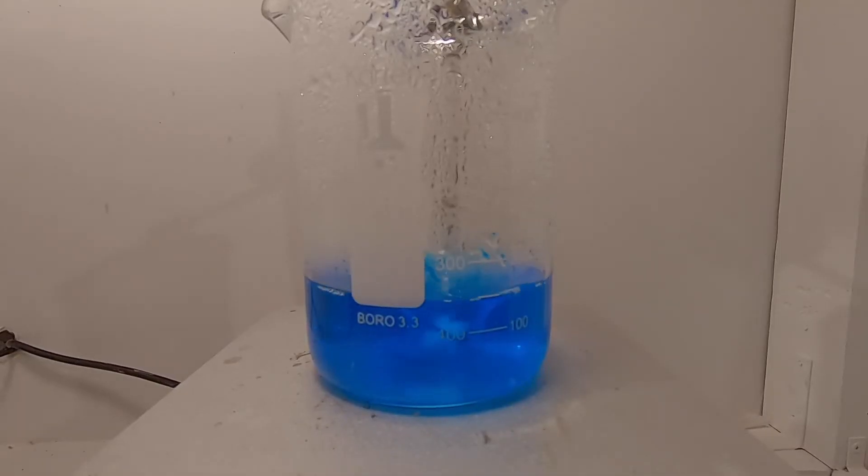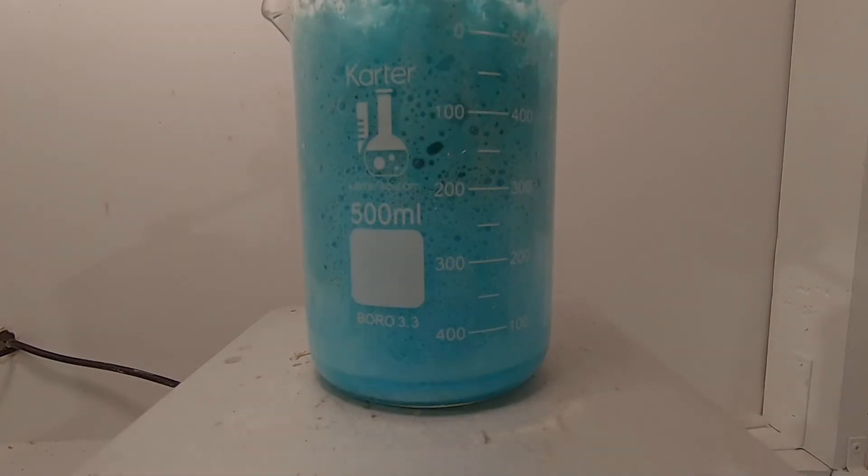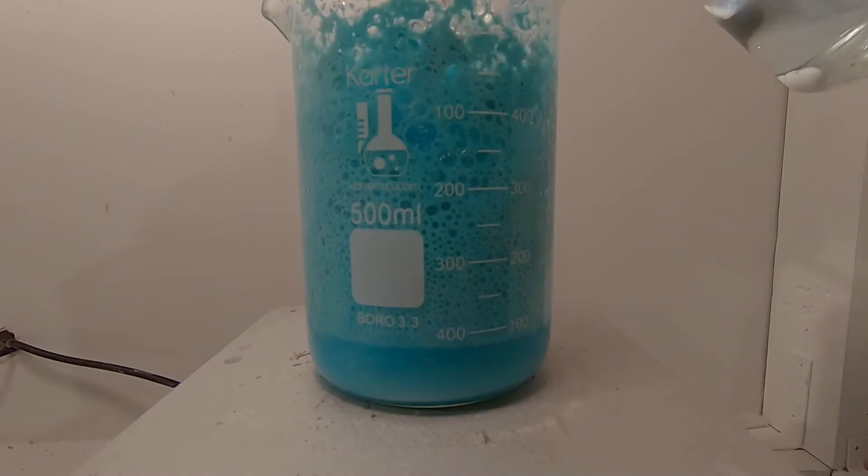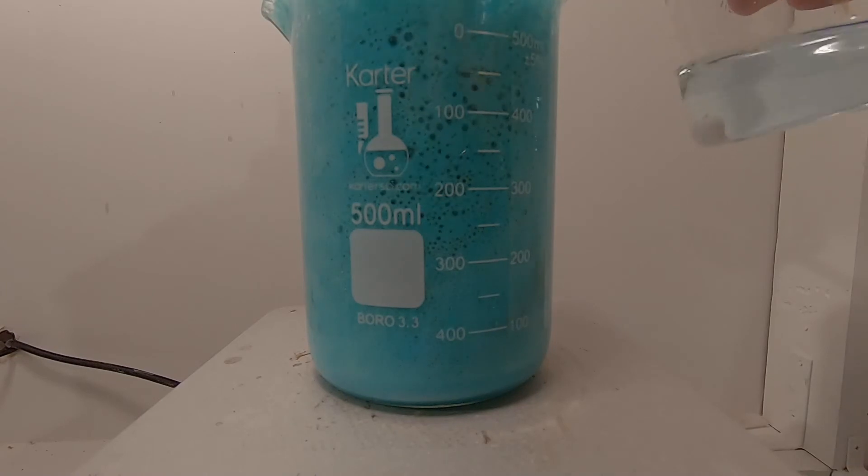Now the fun part, mix the two solutions together with stirring. Basic copper carbonate will precipitate, as it is not soluble in water. You also generate lots of CO2 gas as you see here.